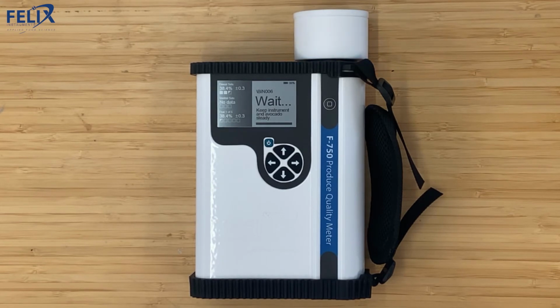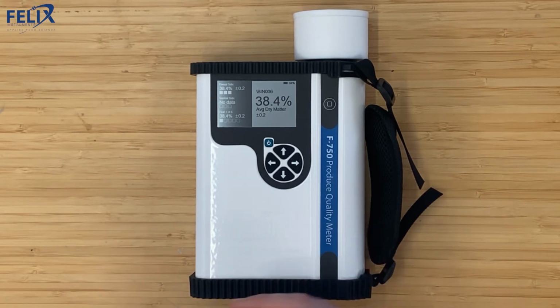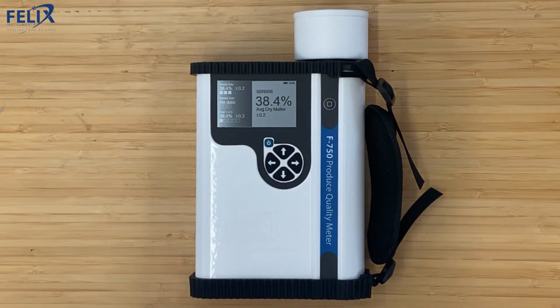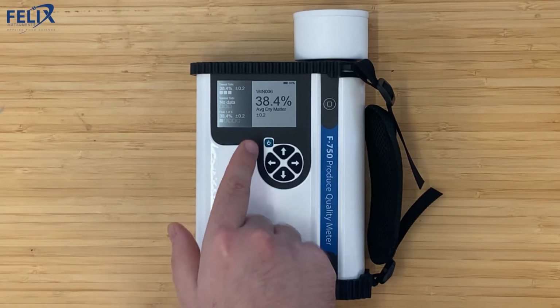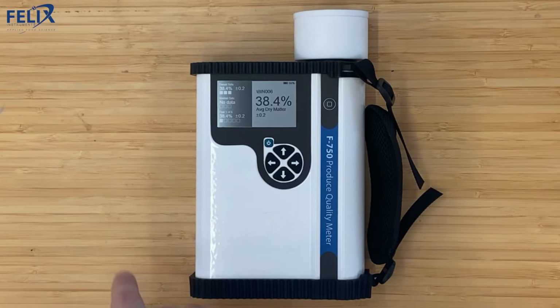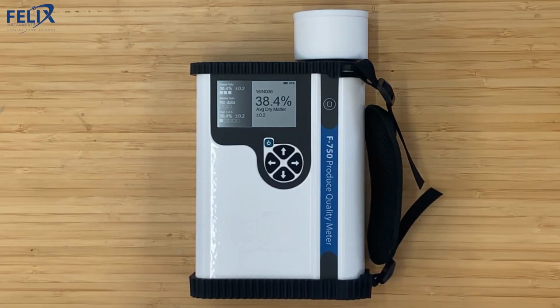And so now that the dorsal side is complete, you can see the average dry matter for the side is displayed, as well as the standard deviation. The 3 boxes on the top are filled, which each represent a scan from that side. If there were 5 scans that needed to be made, there would be 2 additional boxes filled in. You also see that there is a ventral side and a fruit, 1 of 5 displayed, and those each will show data as it's collected.